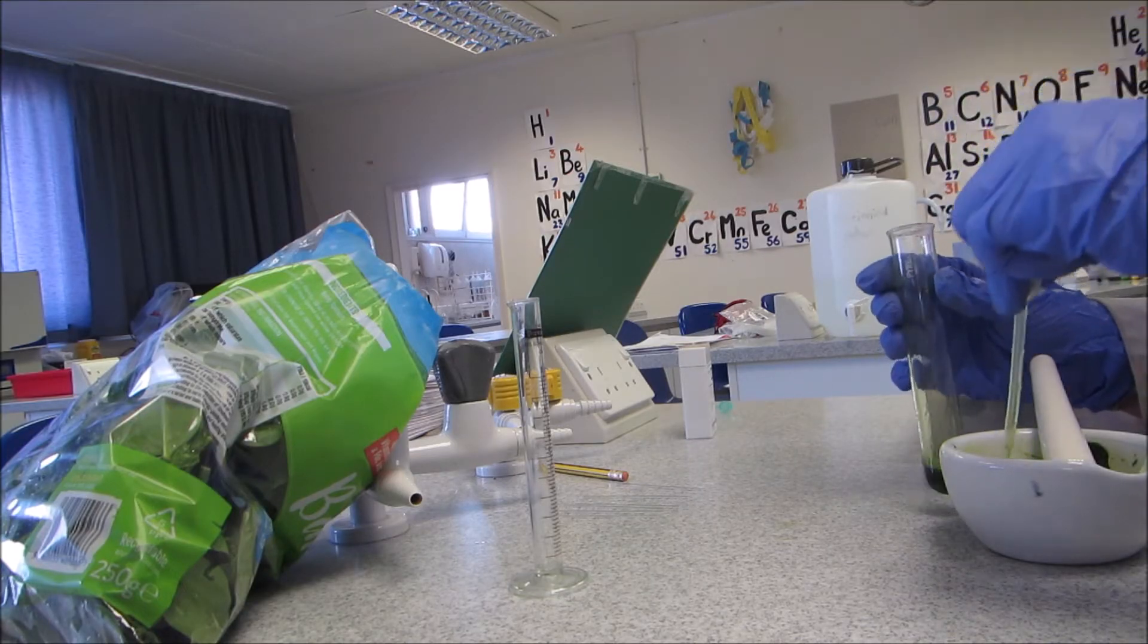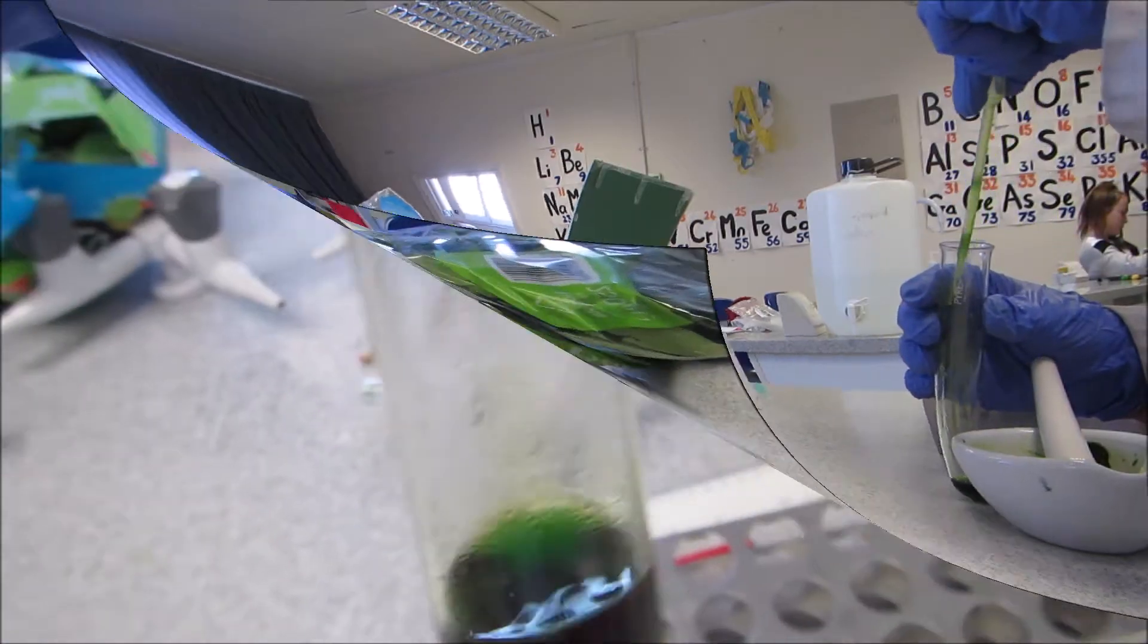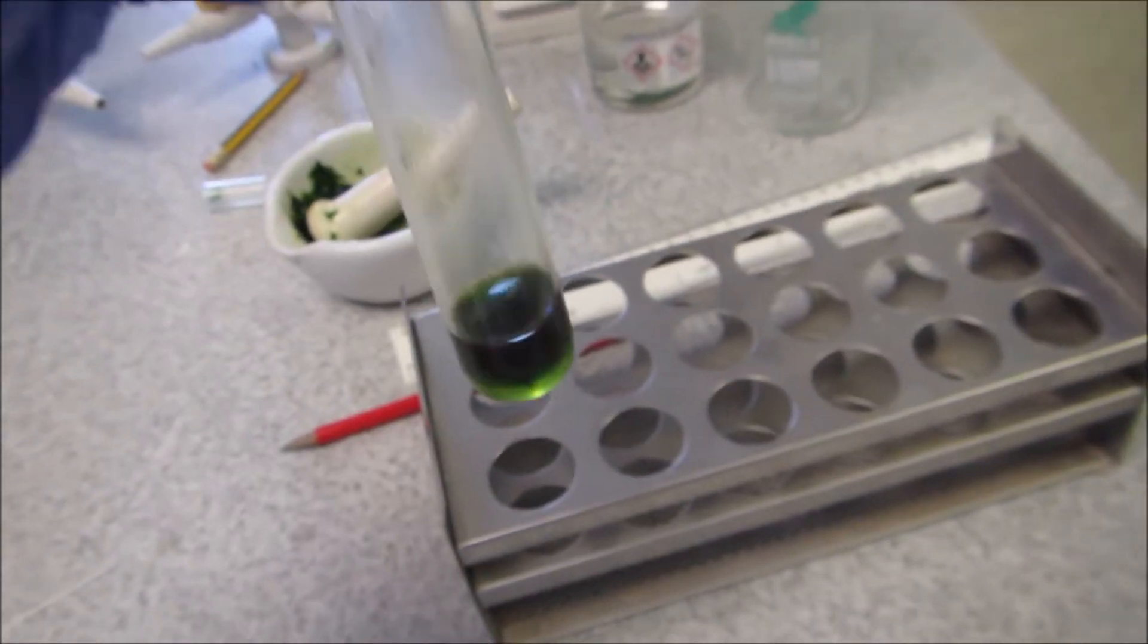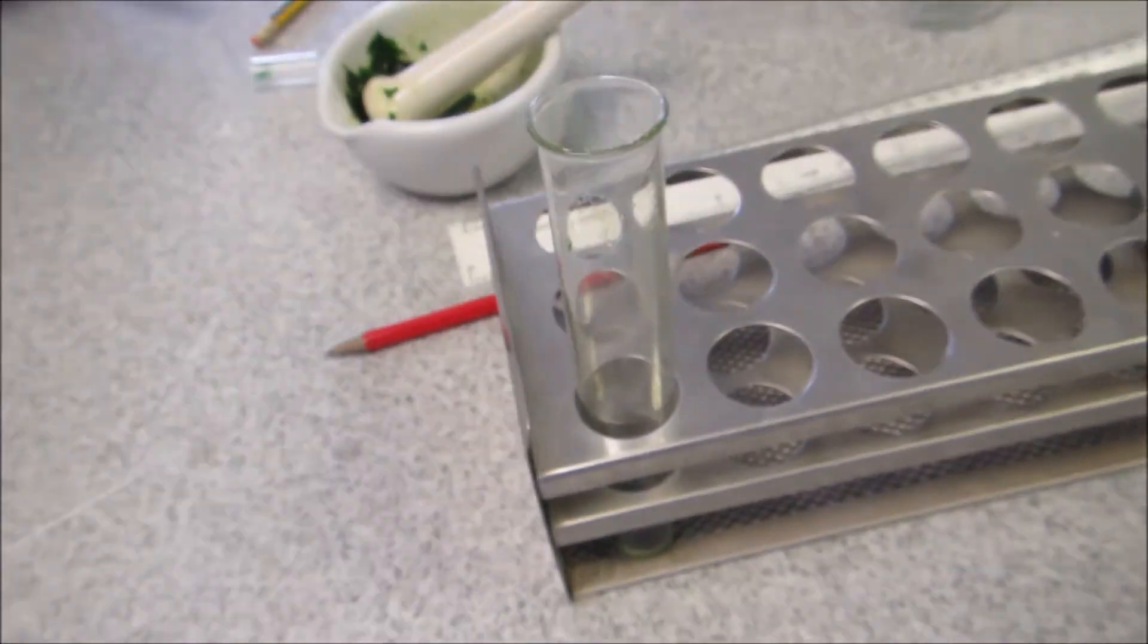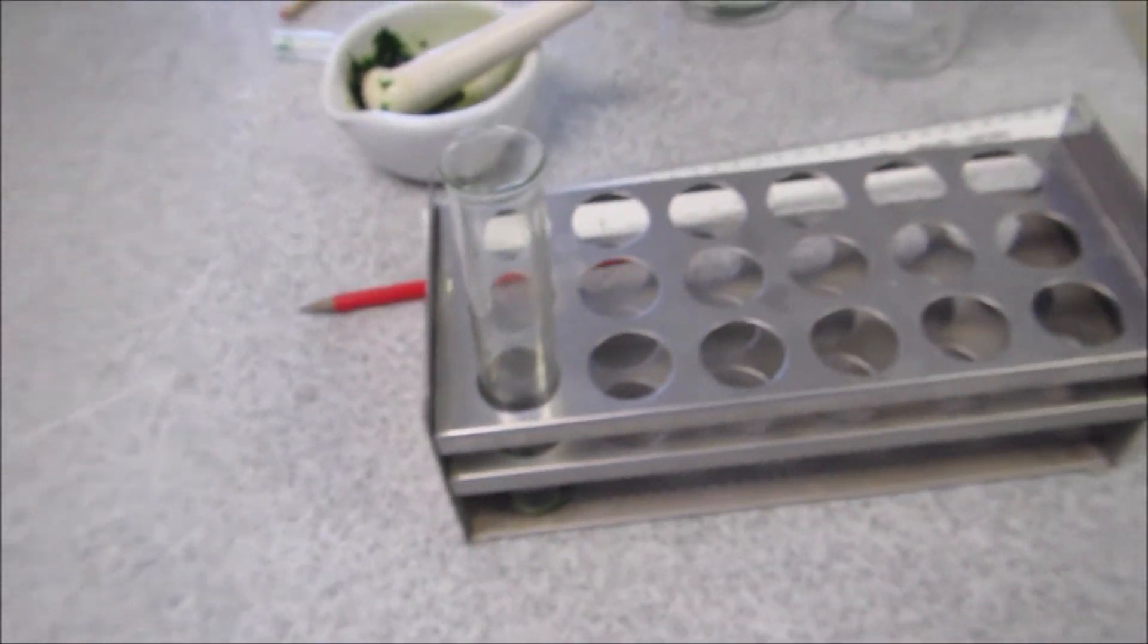Once I've lifted all of this up, I'm going to leave this to settle for about 10 minutes. It's started to separate, and you can see at the bottom it's a nice clear solution. So I'm going to lift that and put it into a centrifuge tube, and then use that to put onto the TLC plate.